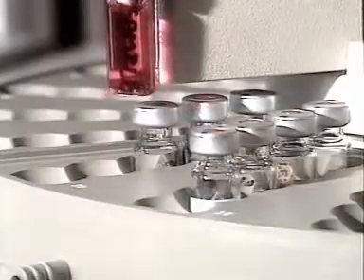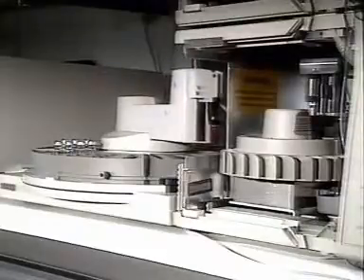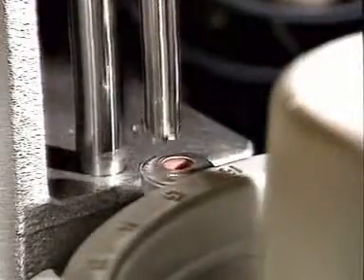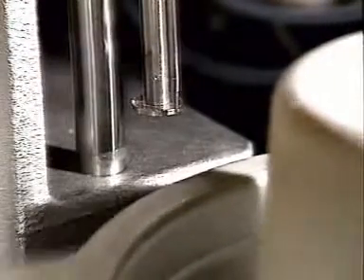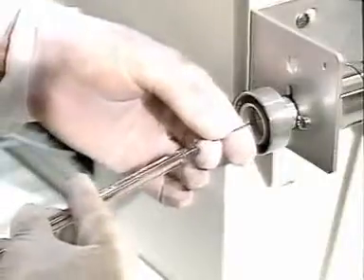The sample is made up at a concentration of about 1 milligram of the solid material dissolved in 1 cubic centimetre of solvent. The bottle of sample is carried to the instrument using an automatic sample changer. About 1/100th of a cubic centimetre of the liquid sample is drawn into the instrument by a hypodermic syringe. With some instruments, the sample can be injected by hand.